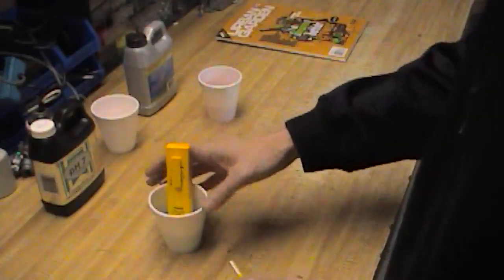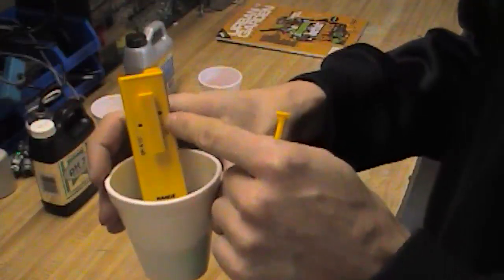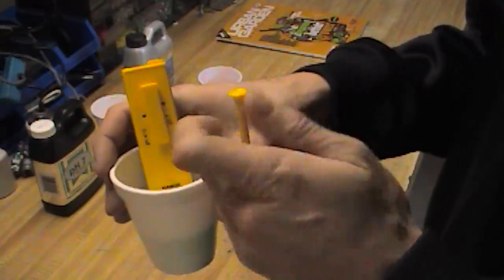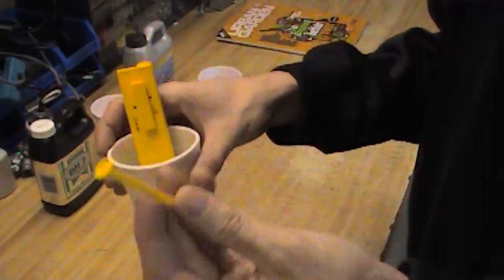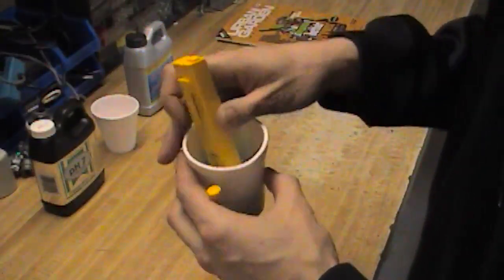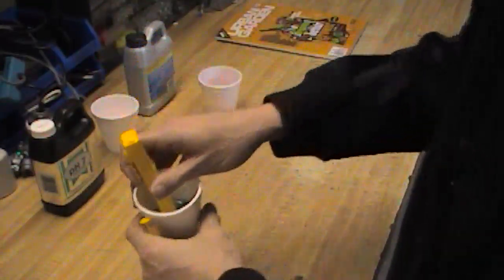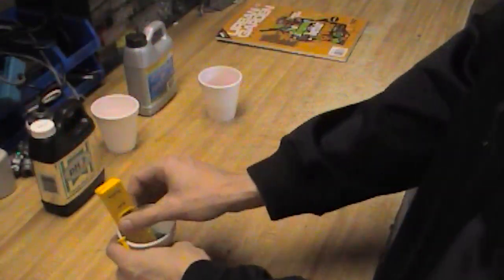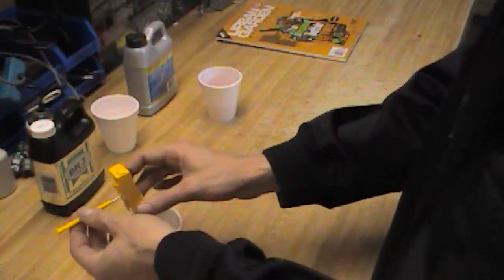On the back of the unit here there's a little hole, and underneath the hole it says pH 7. The screwdriver that comes with it fits into the little hole. If you lose the screwdriver you can usually find little kits at the dollar store or hardware store. Now it's dropped down further to 6.6, so I'm going to use this.